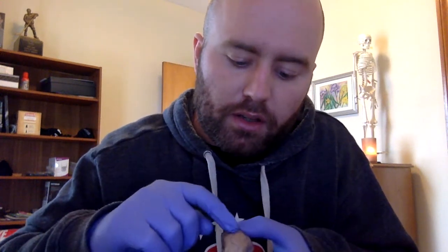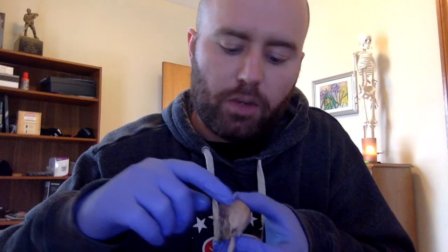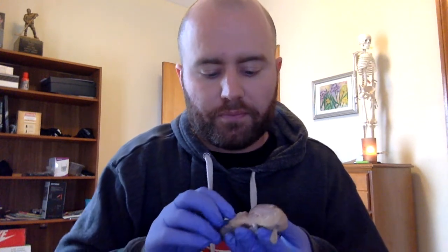Forgot to mention, on the surface of the brain we have these ridges. So the ridge is the gyri, and the indentations are the sulci. Those help increase the surface area of the brain. So the more surface area means a larger brain. So humans, we have a greater degree of gyri and sulci as well as a larger brain. So that's what allows us to have more complex thoughts, more complex processes.